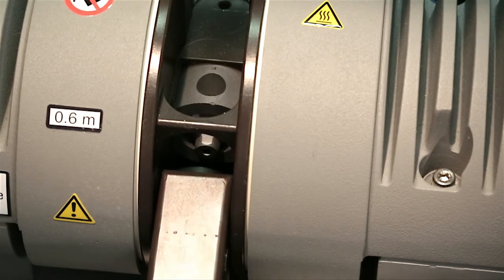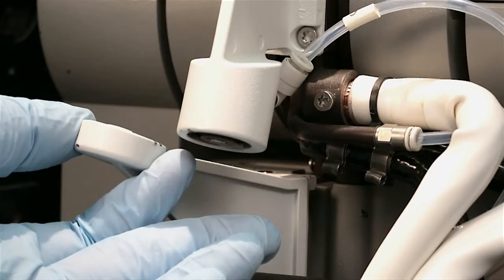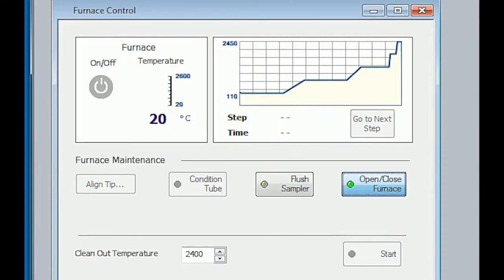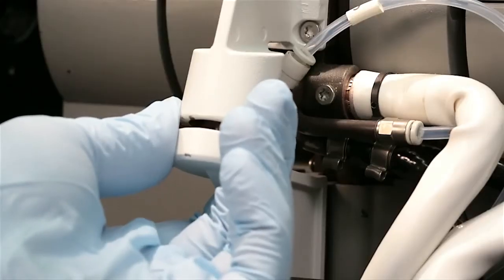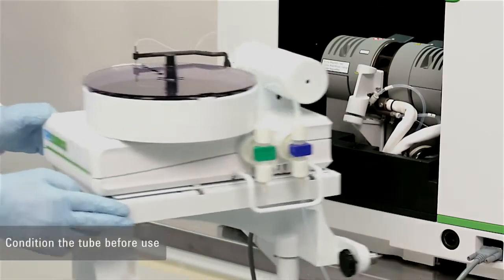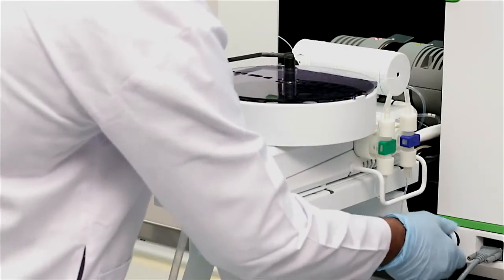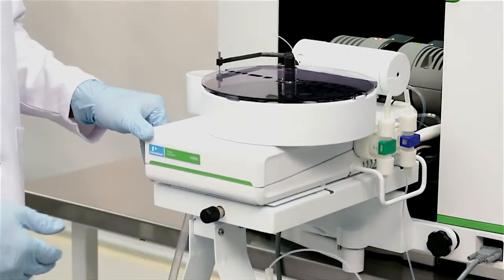Carefully tilt the front contact housing up into the closed position. Swing the support lever underneath. Click the open/close furnace button in the furnace control window to secure the workhead. Swivel the furnace auto sampler back into position and secure. Check the alignment, which I will show you next.